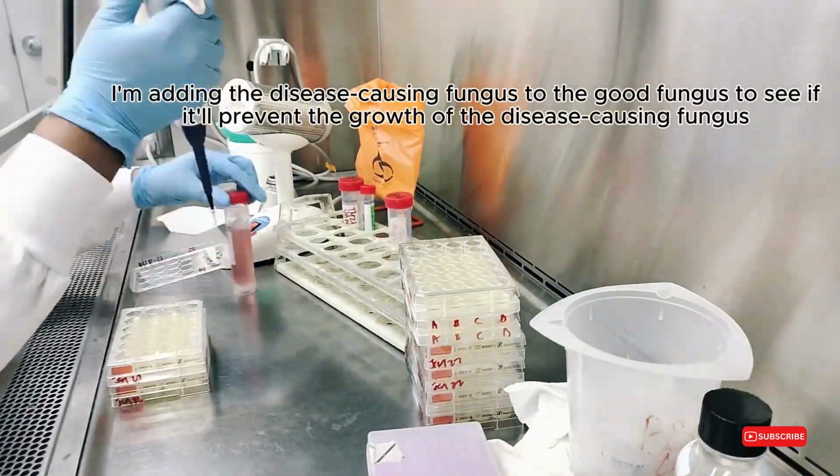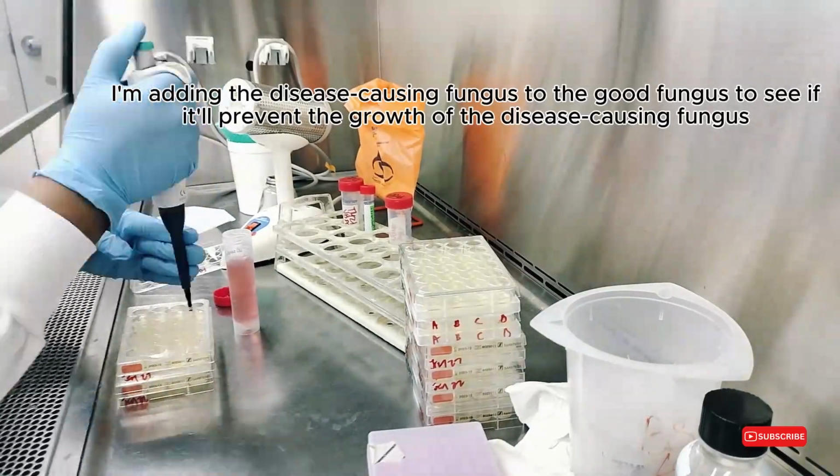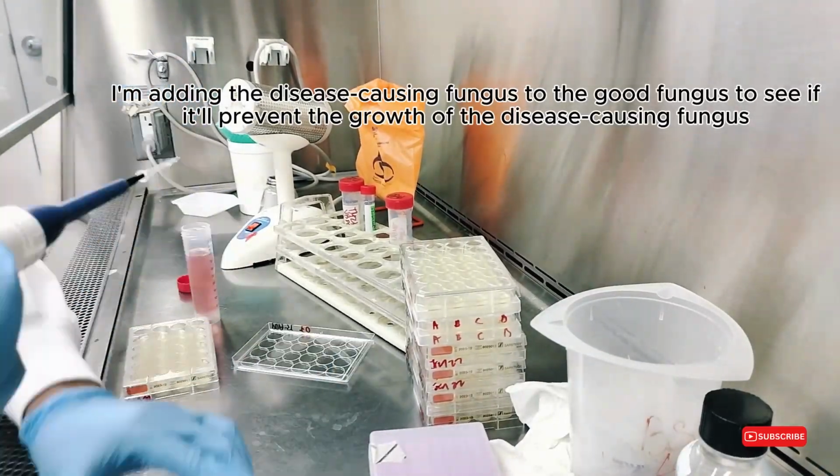I'm adding the disease-causing fungus to the good fungus to see if it'll prevent the growth of the disease-causing fungus.